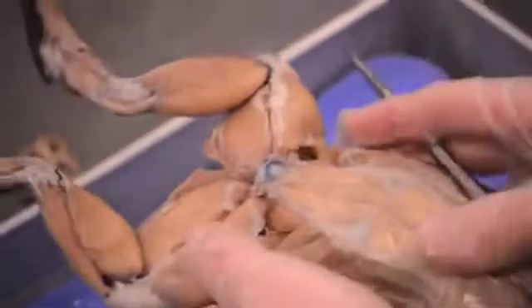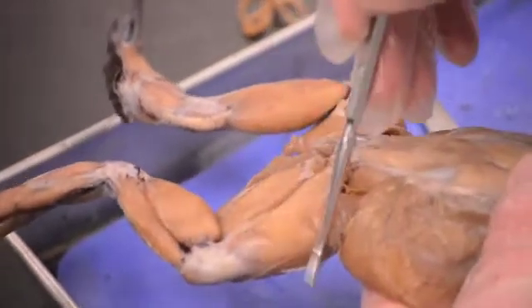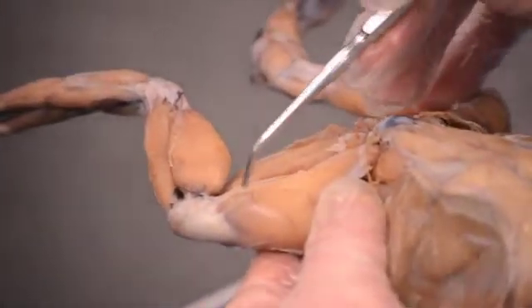Looking at the back of the leg, this big muscle up here is called the triceps femoris. The triceps femoris is very similar to our quadriceps — the difference is that frogs have three muscles here where we have four. Right below the triceps femoris, there's a thin muscle in the middle called the vastus externus.